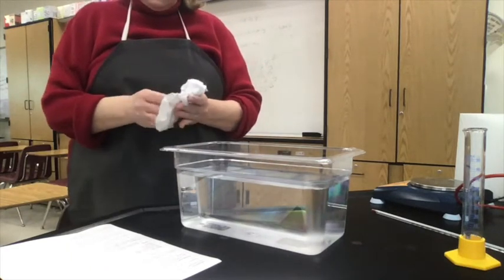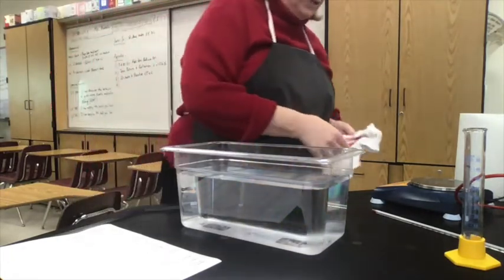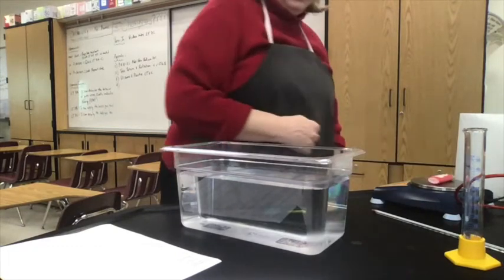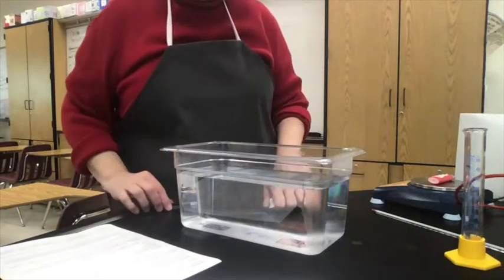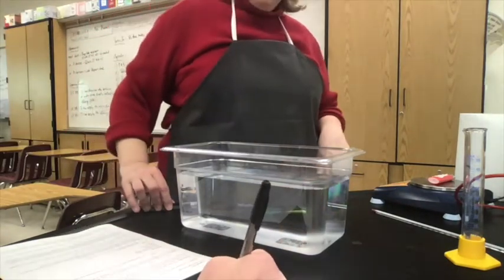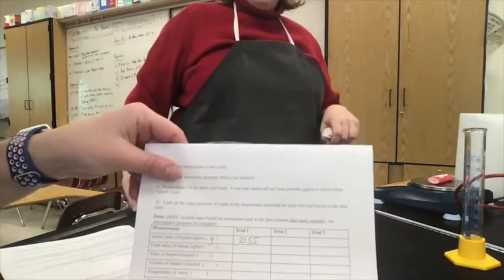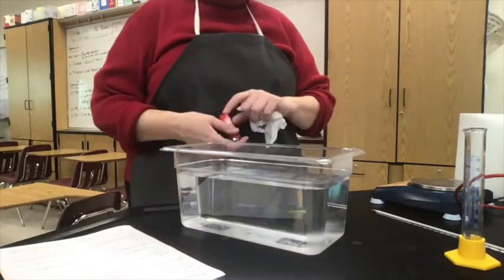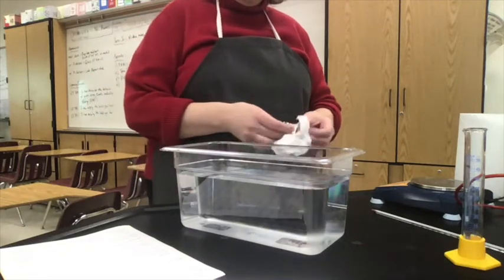Now we're going to take the mass of the butane lighter and record it in the data table. Remember to zero your balance, then place the butane lighter on the balance. The first piece of data is the initial mass of butane: 21.55 grams. Notice I'm reading all of those digits on the balance — I'm not rounding this off. This is lab data, so we read our instrument to its full capacity.